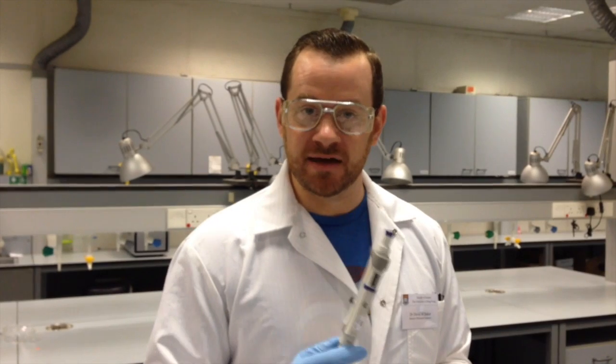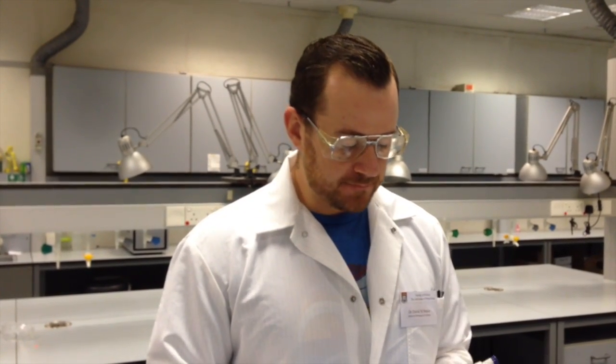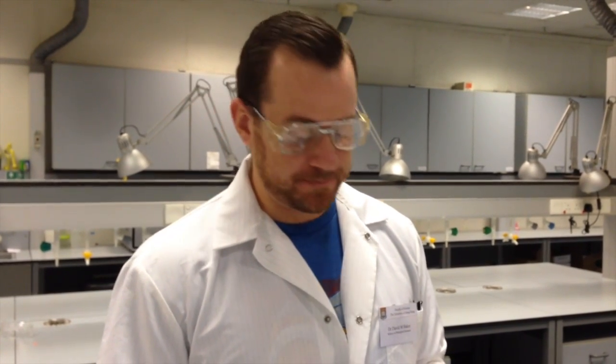But to begin with, I need to get the reagents ready for the chemistry that can help us reveal that color change. The main tool I'm going to be using today is my micropipette. Again, if you don't know how to use one of these, please review the tutorial from last week on how to properly use a pipette. Pipetting in this class, for this section, is going to be really important.